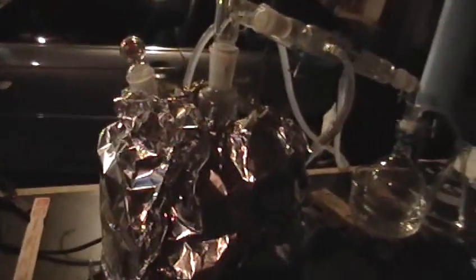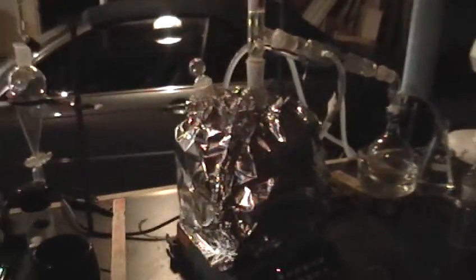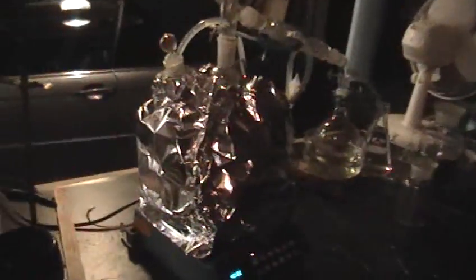I'm here with my buddy Ryan Treadwell, and this is the distillation of the mercury in progress. It's alternately flashing the setting temperature and the current temperature. This is the boiling flask — it's dual neck, and it's wrapped in aluminum foil to prevent air currents from taking energy out of the distillation.